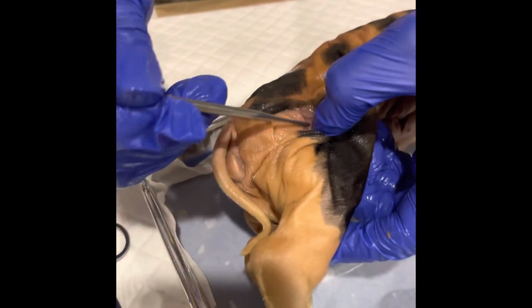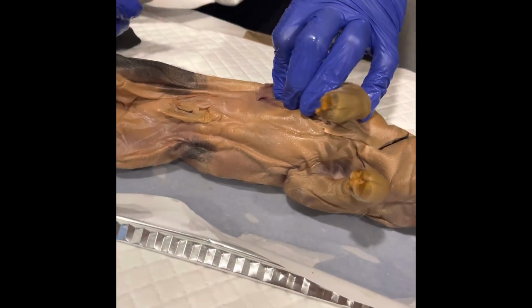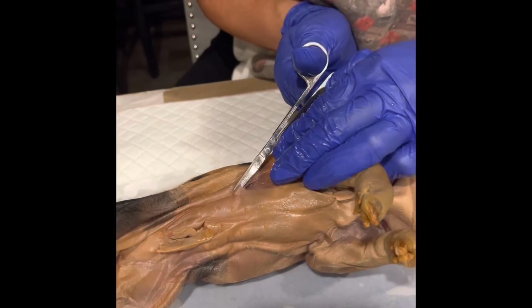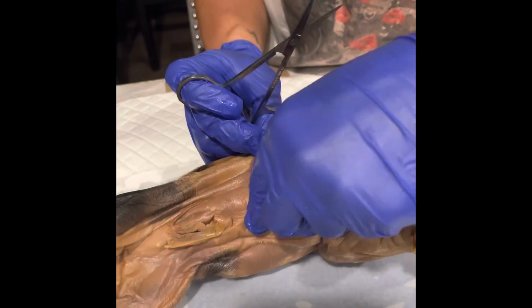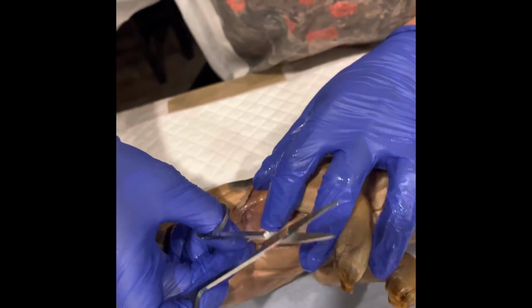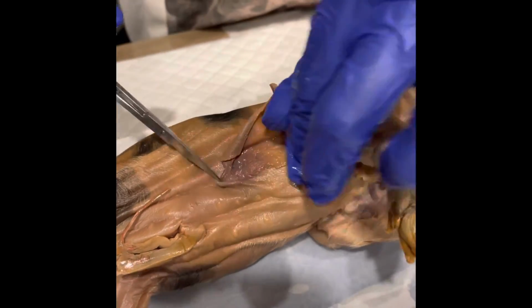I did notice a covering around the spinal cord and noticed that the spinal cord was actually enclosed in a protective-like tissue. I did go on to learning that the protective tissue is called the meninges, and that meninges actually forms a protective sac around the spinal cord.